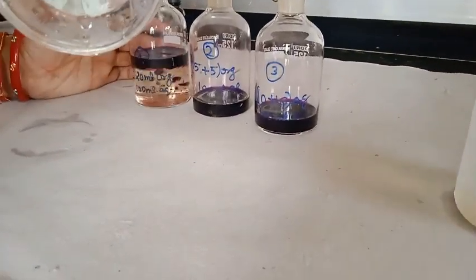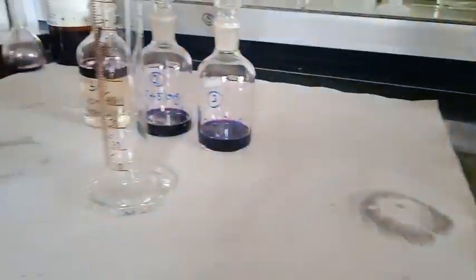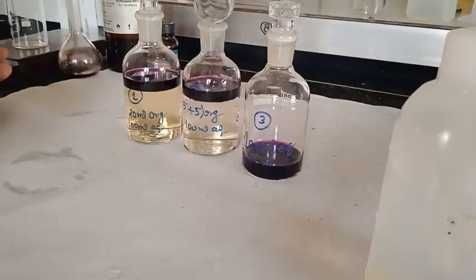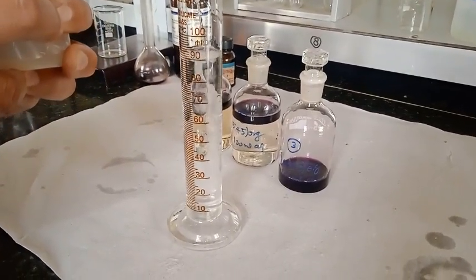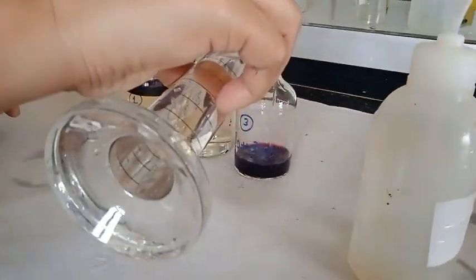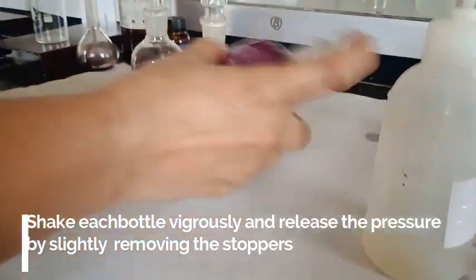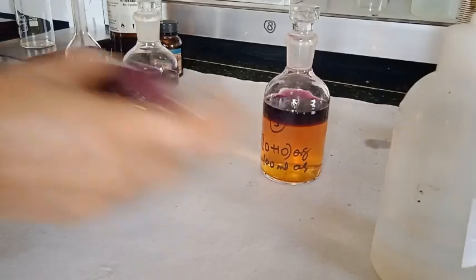So I have added 100 ml to the first set. Now I am going to add 100 ml to the second set. And now I am going to add 100 ml of distilled water to the third set. So here, after adding this distilled water, we are going to shake the reagent bottles, and because of the organic layer a pressure builds up, so release this pressure by loosening the stopper on the reagent bottle.